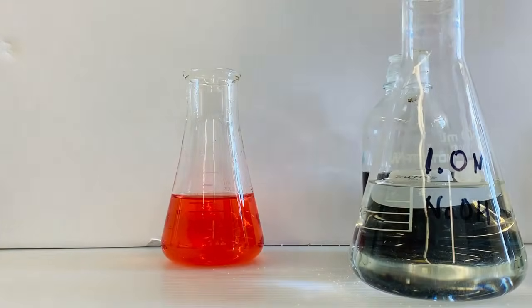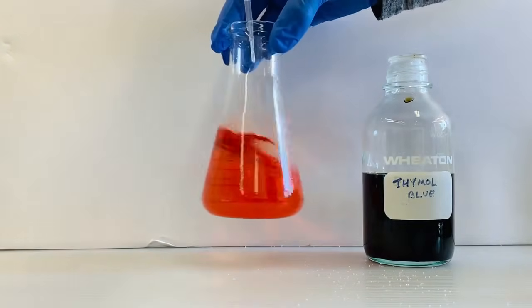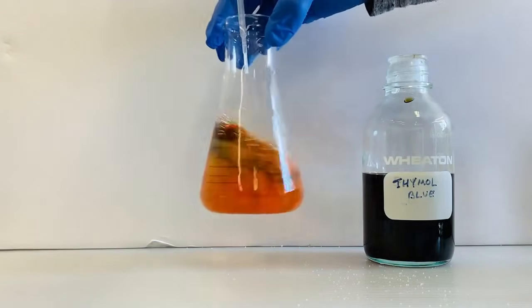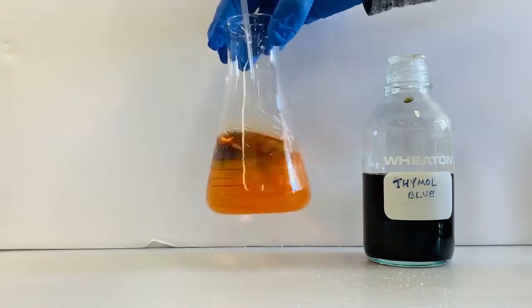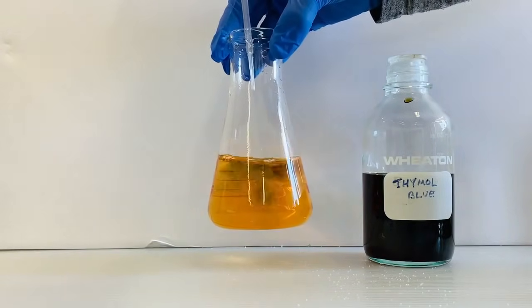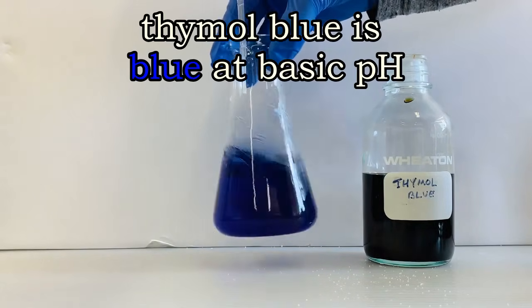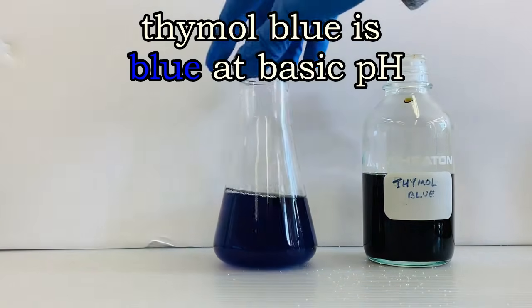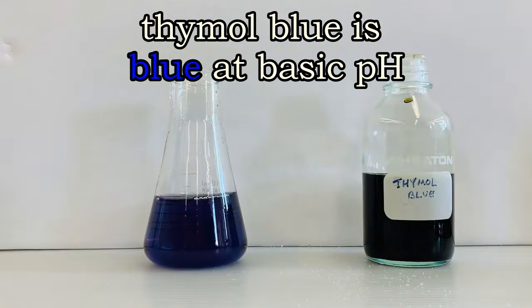Finally, we'll add some base. We first see the color change to yellow as the base neutralizes the acid. However, as we continue to add the base, the color of the thymol blue changes to blue. So indeed, thymol blue is blue in a base.